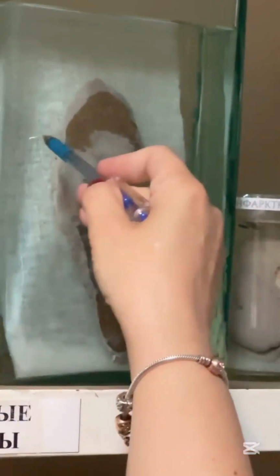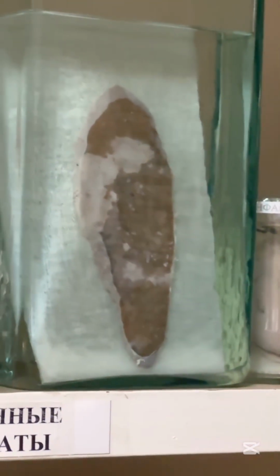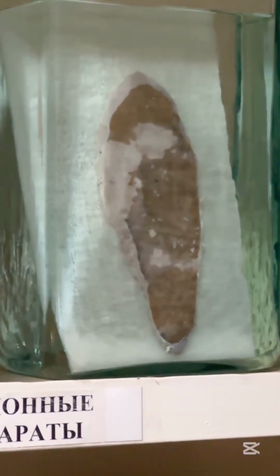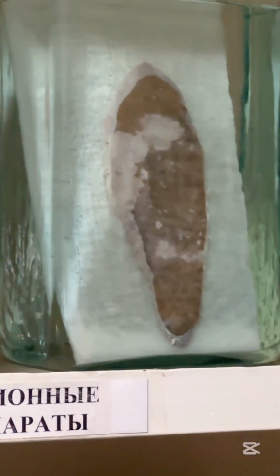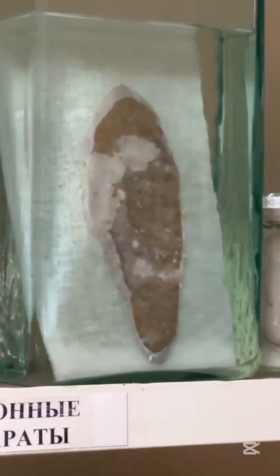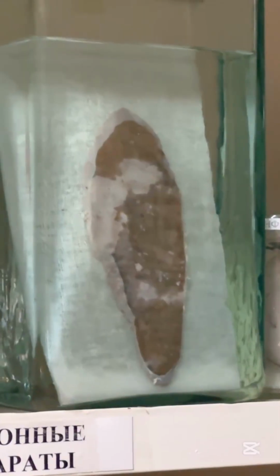Then this one, it is splenic infarctions. You can see whitish areas with infarction. Again, you should know characteristic. It is wedge or triangular shape and pale in color. Pale triangular. Microscopically, that is coagulative necrosis because that is solid organ, a lot of lipids in it. Oh, sorry, proteins, a lot of proteins. That's why coagulative necrosis.